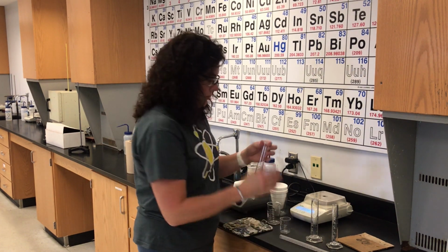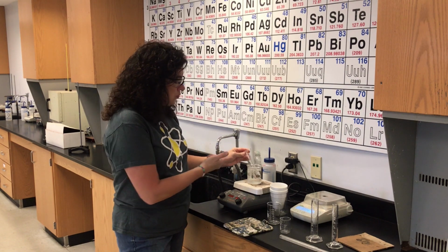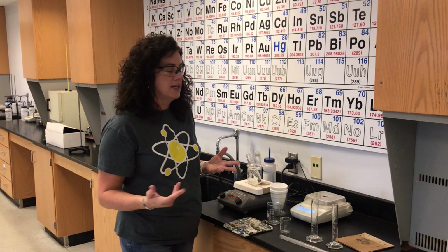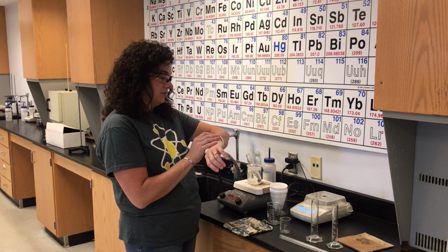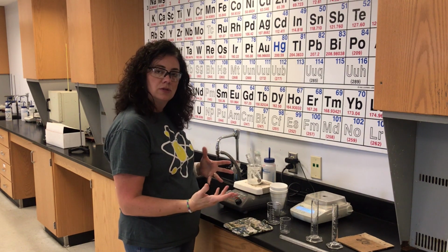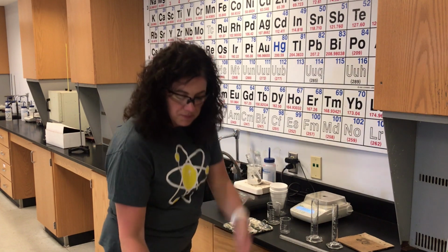The procedure also tells us that I need to heat this metal for 10 minutes, so I'm going to heat it in the tube. Guys, what is the temperature of boiling water? It should be 100 degrees Celsius. If I leave that metal in there for 10 minutes, and we'll start a 10-minute timer, then the metal should reach the same temperature. It said it can't set the timer. I just love that technology. The metal should reach the same temperature as the boiling water.